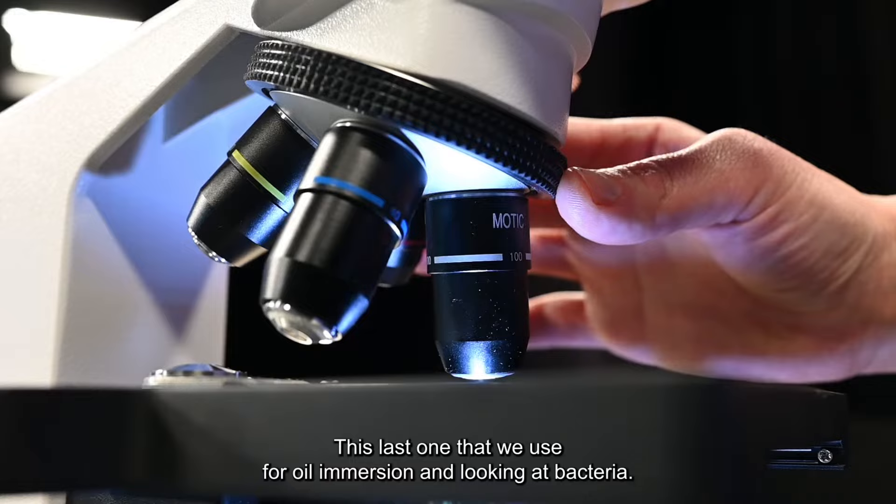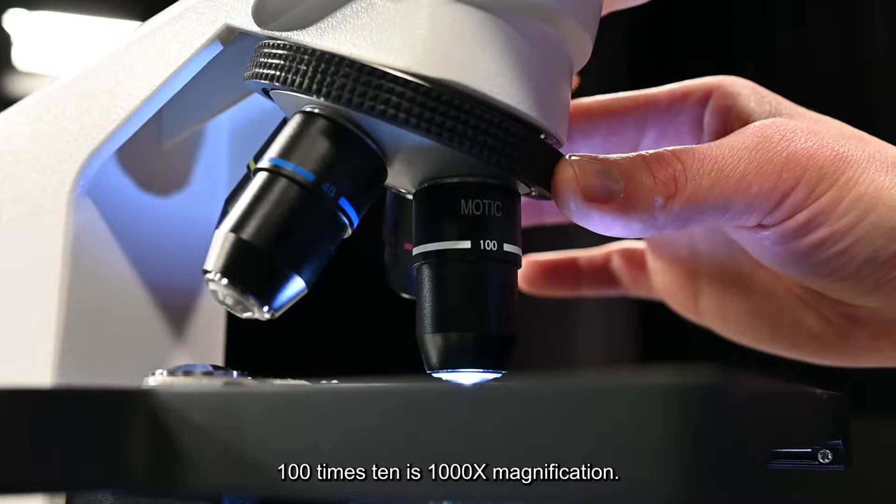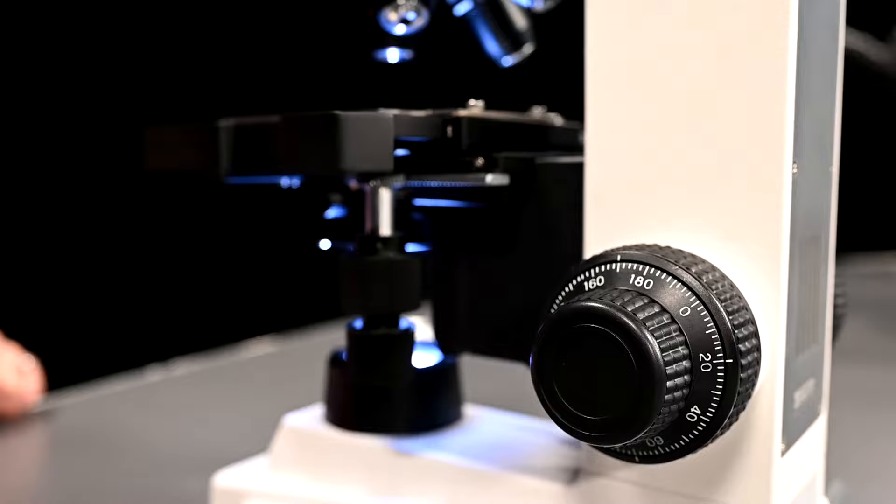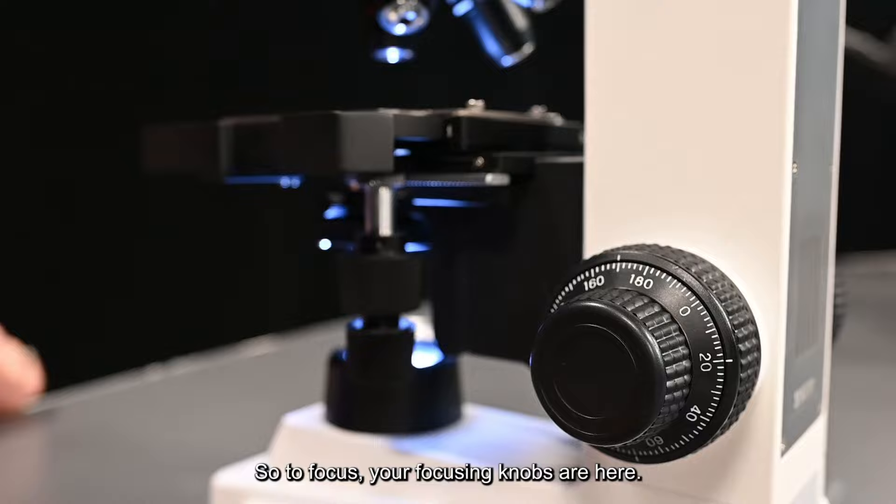This last one we use for oil immersion and looking at bacteria. This is a hundred. One hundred times ten is one thousand times magnification.